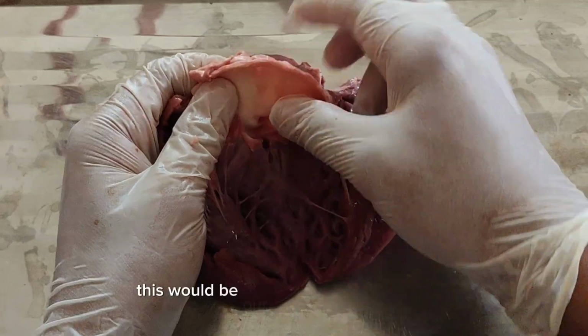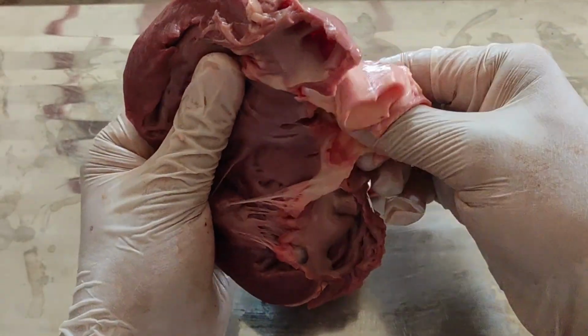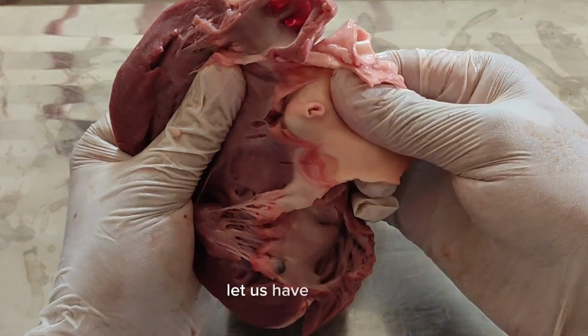This would be our coronary sinus, I believe. Further open it.